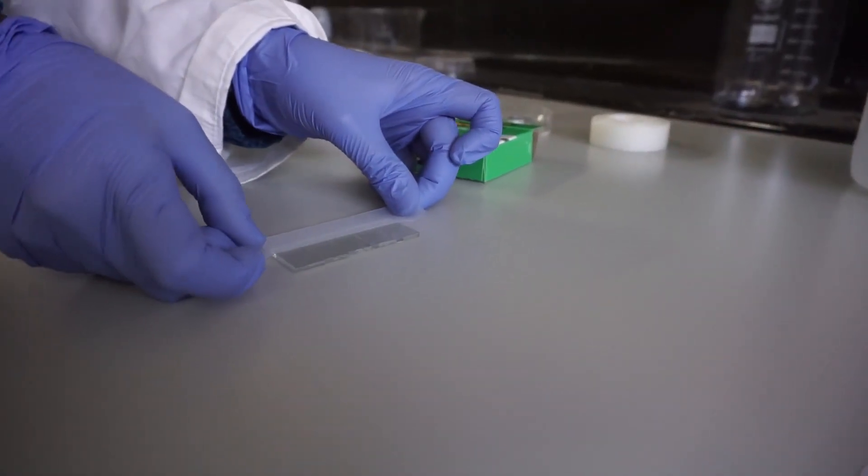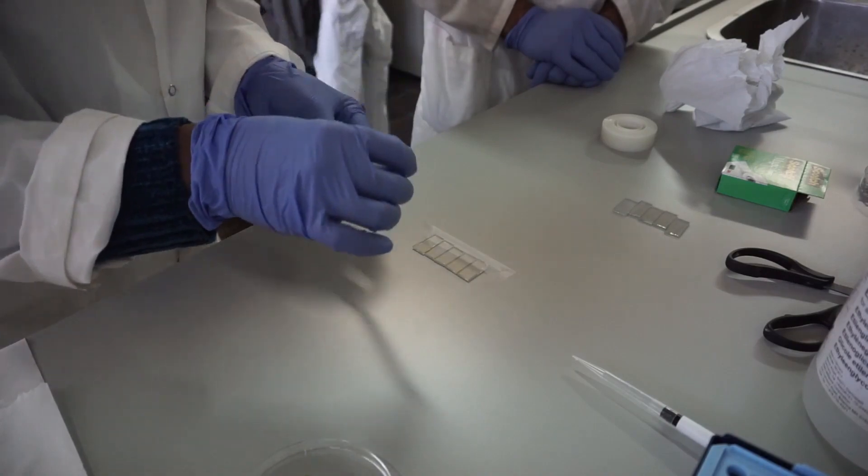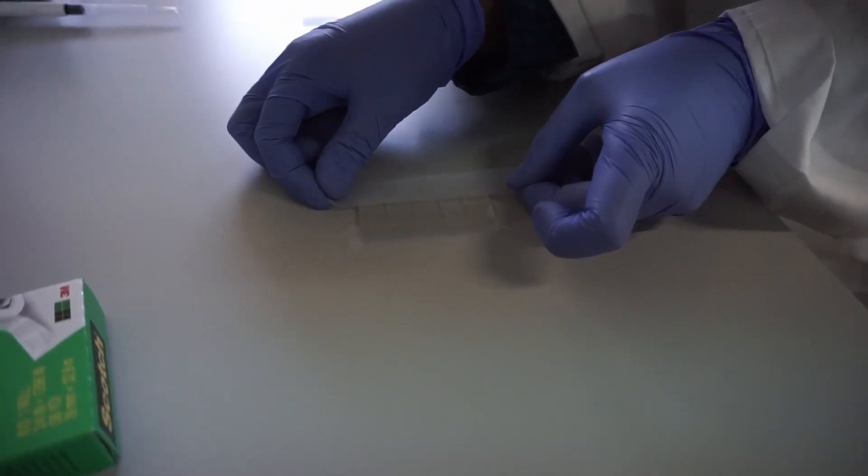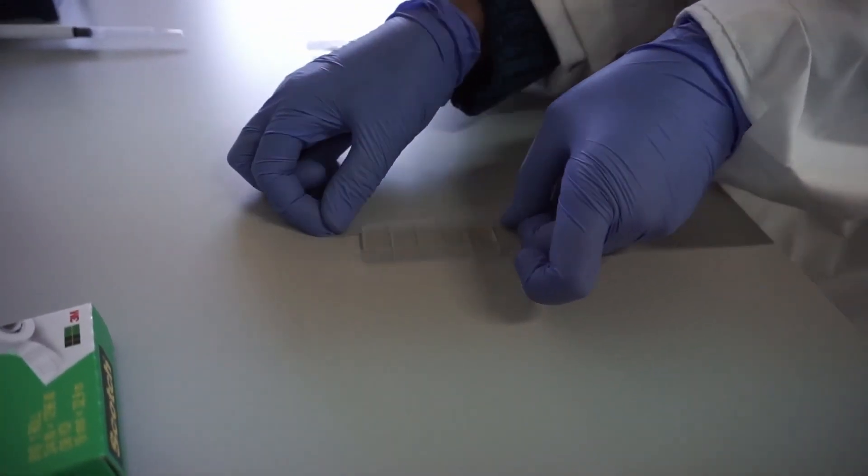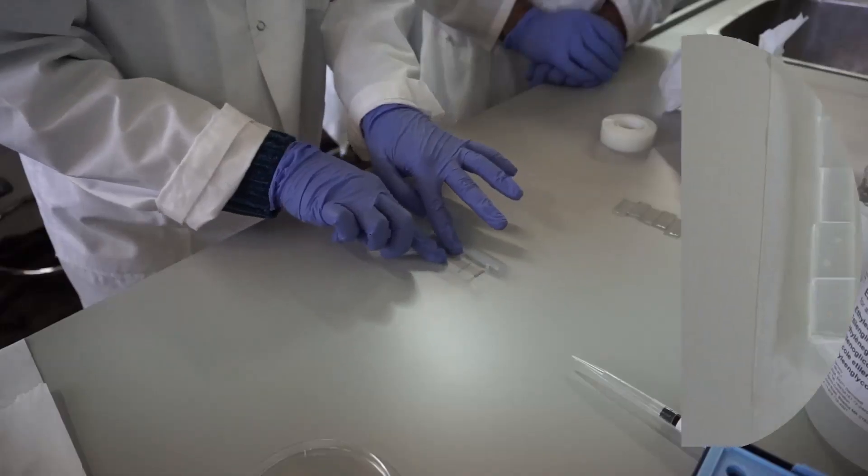You can tape several pieces at once instead of working on every piece individually. The amount of tape layers will determine the thickness of your spread.